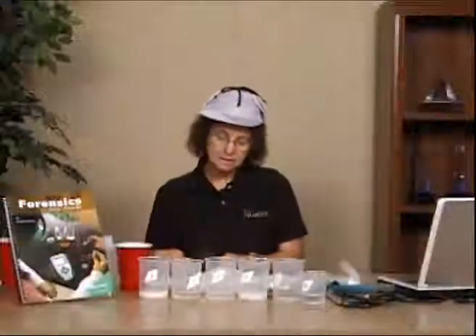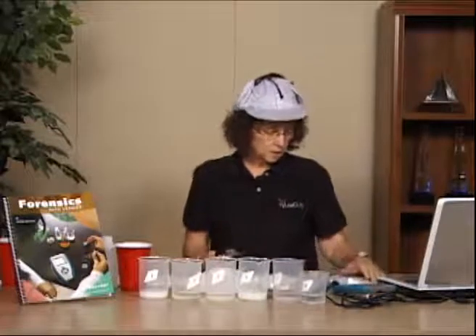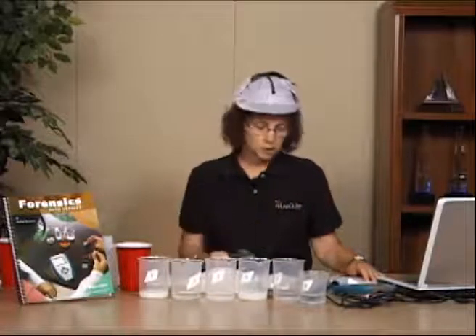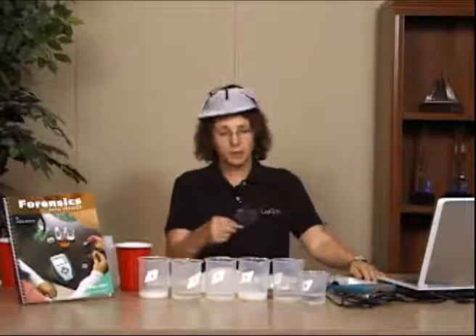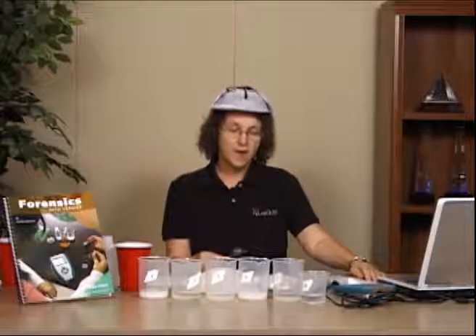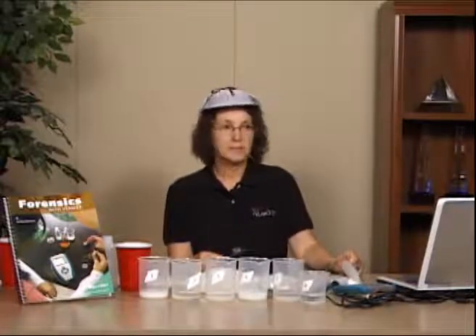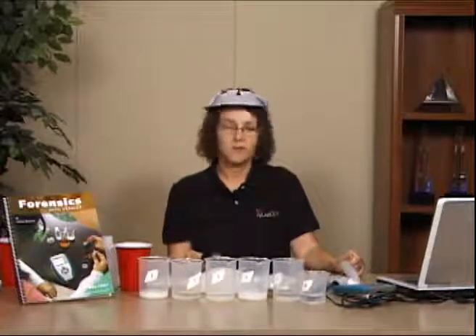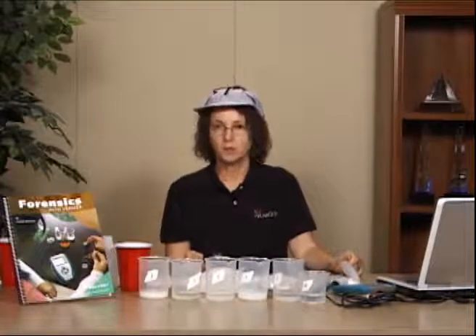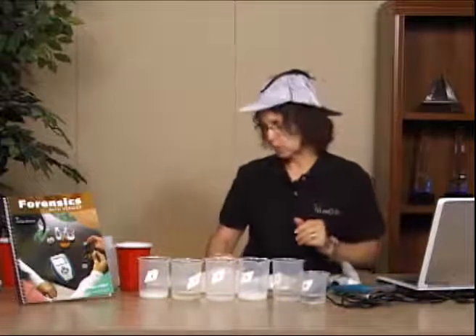I recently did this lab with a group of teachers in Texas, and my unknown was one of the 5. It was actually a combination of one of the 5s. But for the sample that they put in as sample 1, 2, 3, 4, 5, I had ground it down, and for the unknown, I had left it as a clump. And so many of them, just by doing cursory observation, couldn't tell what the unknown was, unlike the difference between sugar and baking powder or sugar and flour.